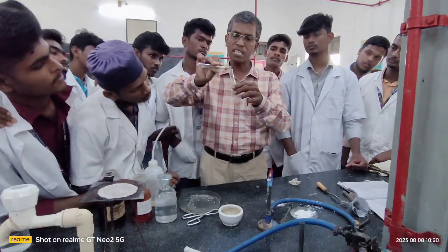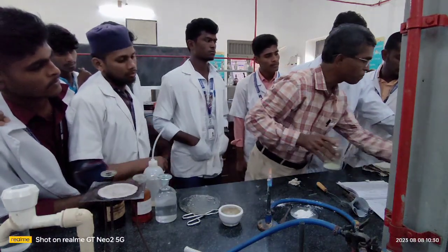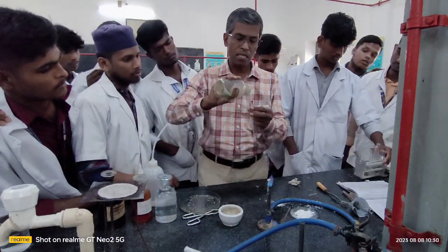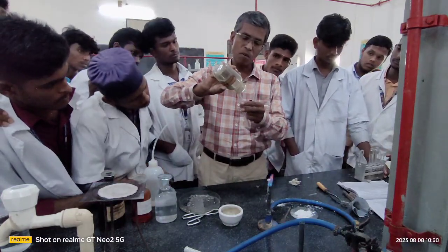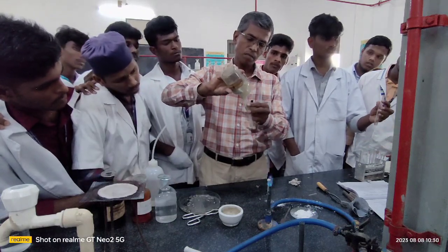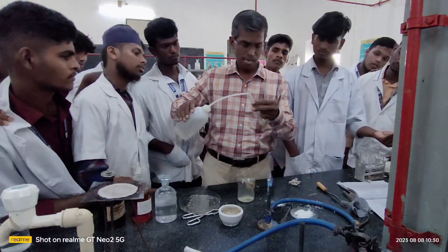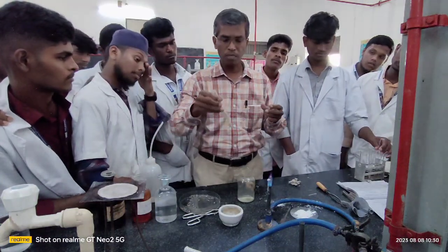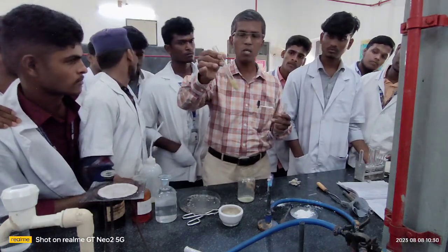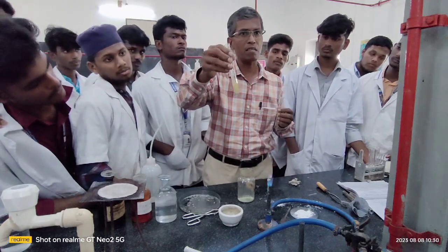To this add freshly prepared ferrous sulfate. How to prepare the freshly prepared ferrous sulfate? Take some fresh ferrous sulfate, add water to this and shake it well. Shake it. Now the solution is ready. This solution is called freshly prepared ferrous sulfate.